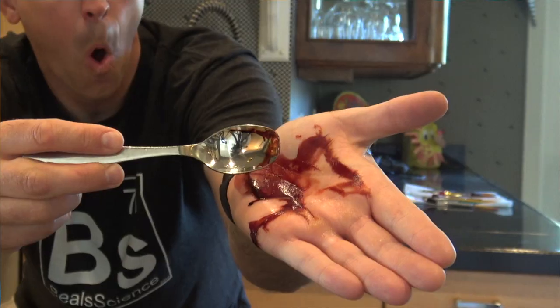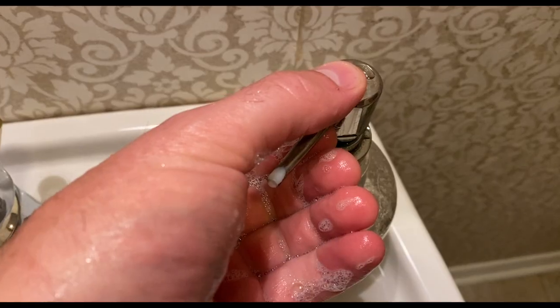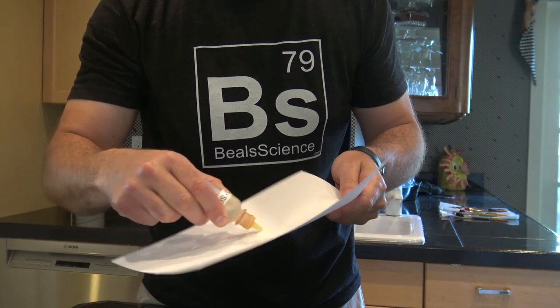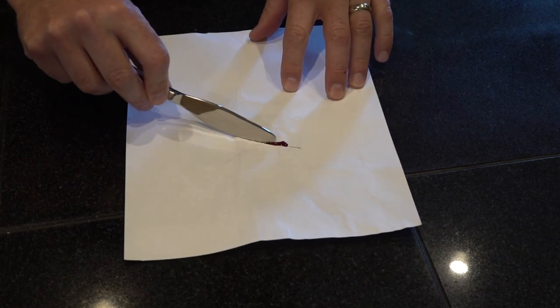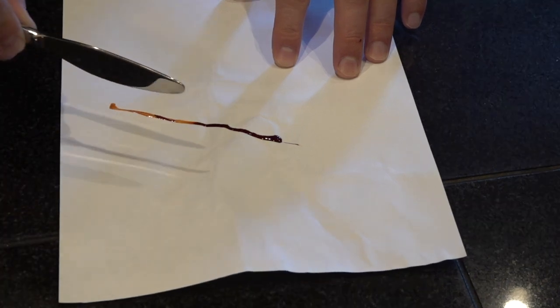Of course, I remind them this is not real blood. This is just to show the chemical reaction and make it fun. It's a great Halloween demonstration. You can do it with paper as well, so you can really get creative around Halloween time with your chemical reactions by making some paper that will bleed as you write.